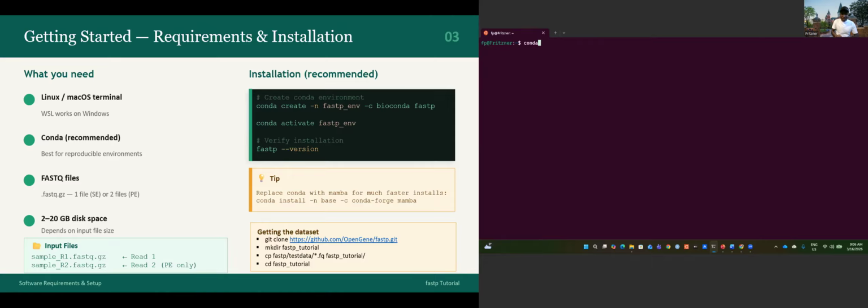So let's do conda activate fastp environment. I think I mistyped it. Okay, fastp environment. Let's see what is changing. Sometimes it takes maybe one or two minutes, depending on the speed of your computer. You see my environment is activated. So now I am ready to work.